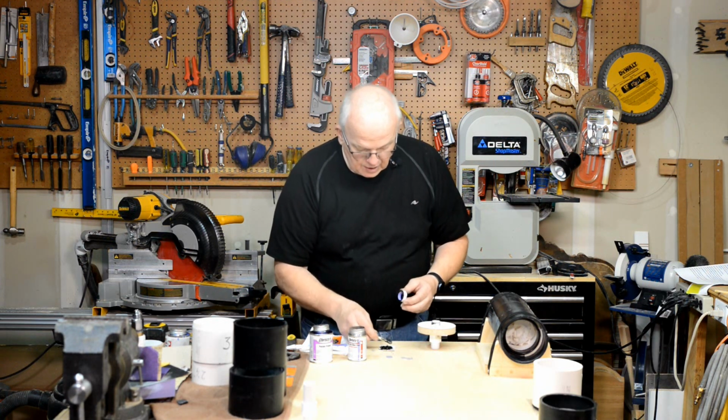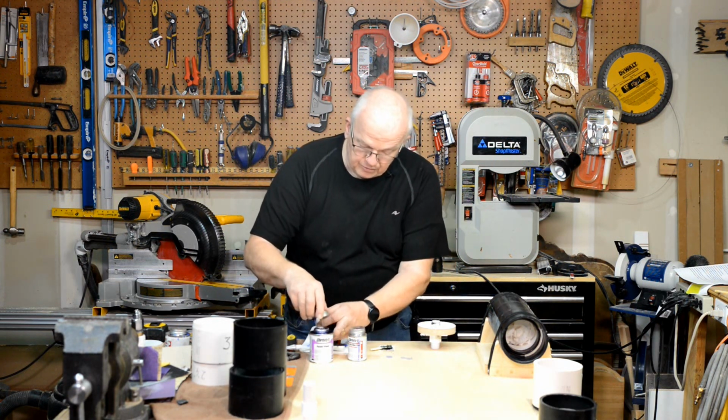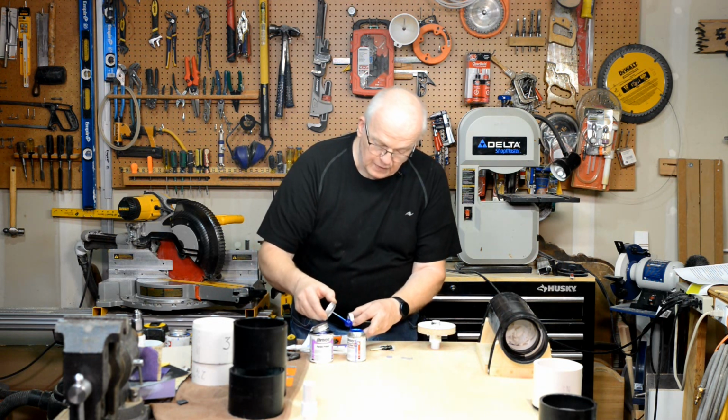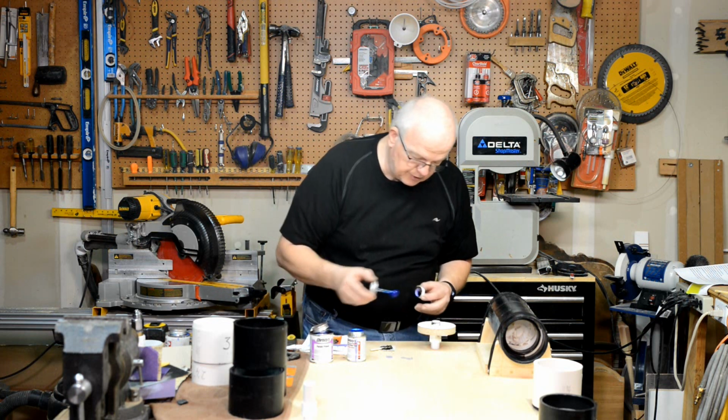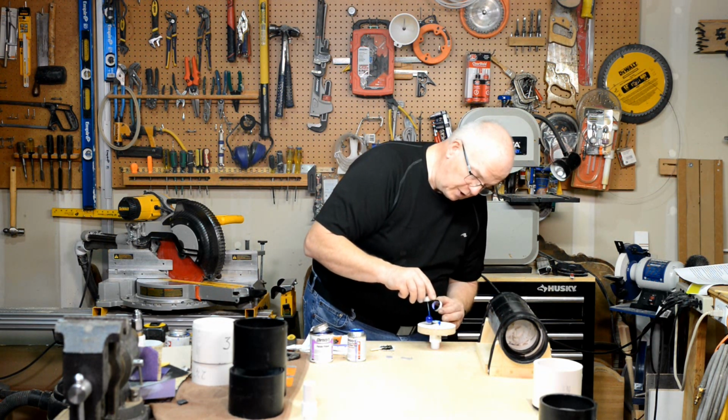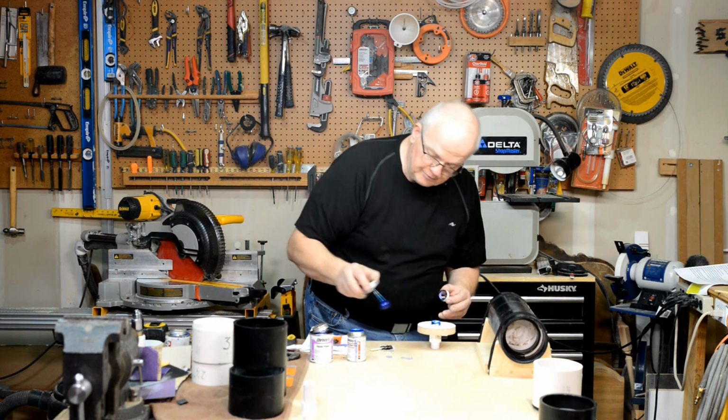Okay. Now here, you want to take a little bit of cement, just a hair, not much at all. Dip it down on there, and you want to apply a little bit of cement fairly liberally all around this edge. Okay.